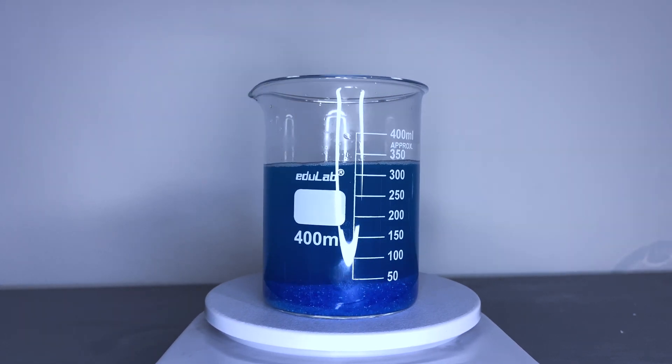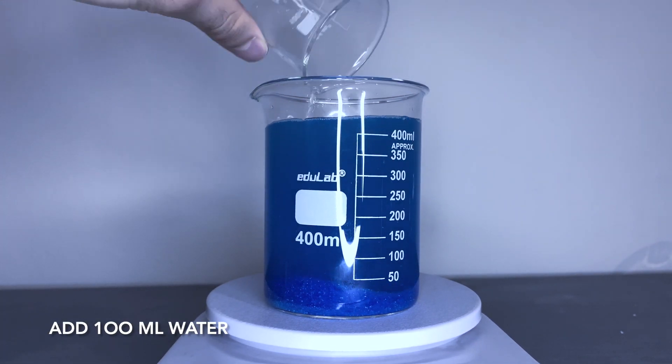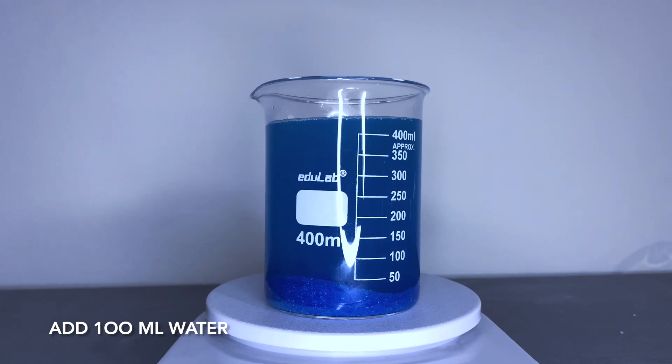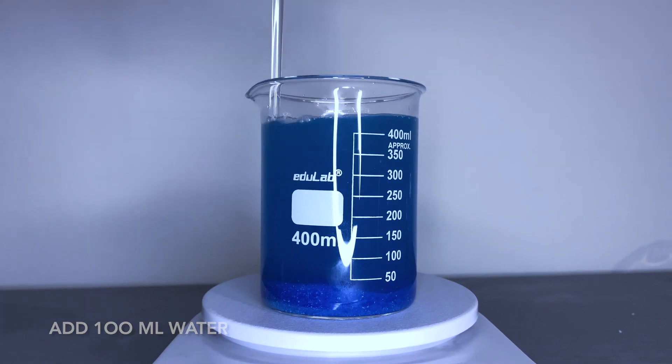Now, I see that 350 ml water is not enough to soak copper sulfate salt. So, I am adding a little more water.